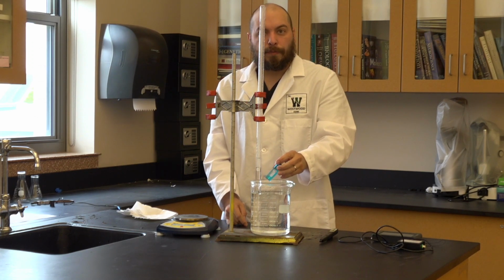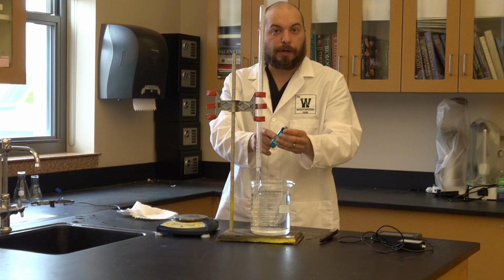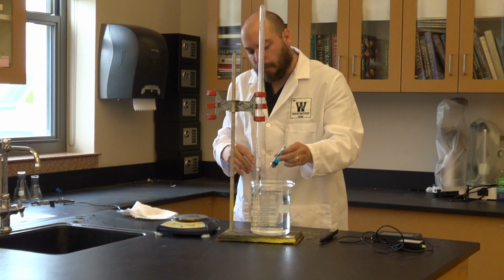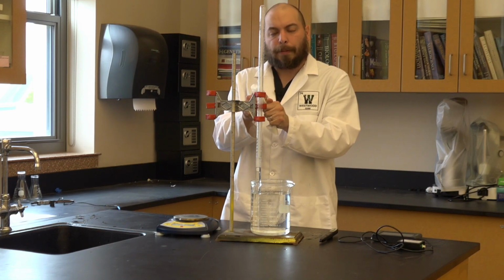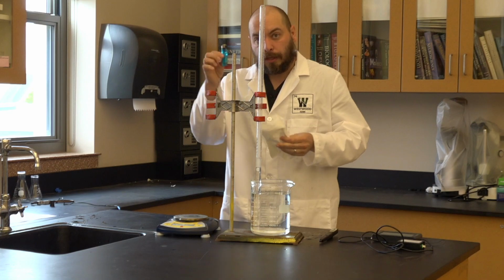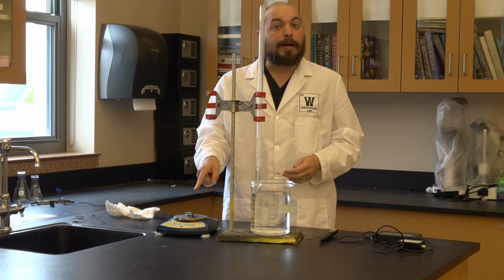But first thing I need to do before anything else happens, I need to get my actual lighter here. I need to dry it exactly like I did beforehand. So I'm going to shake it off a little bit, take my towels that I was using earlier, and try to dry it to the exact same degree I had dried it earlier. And then I'm going to measure the mass. That is my final mass.